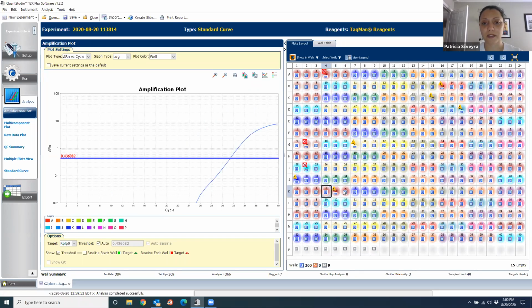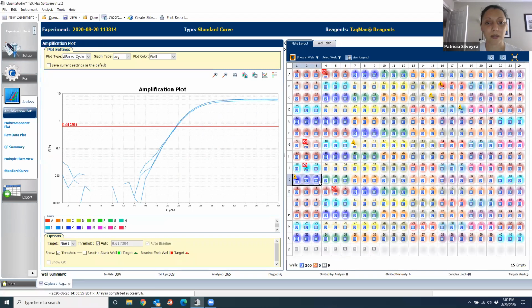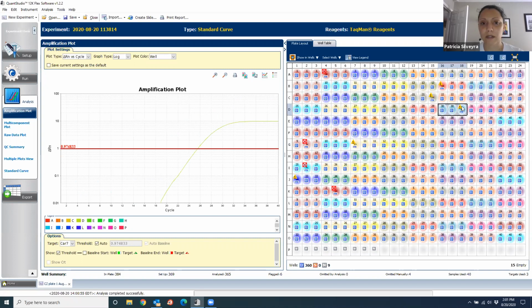See, the first well is okay, second well, the last well is okay, middle well, here you forgot to pipette it. So perfectly fine. So if we omit it, now we got rid of the problem. And now we have this one that, again, it shows like an error, but I think it's because of all of this that's happening here. So we don't care about that because it doesn't affect the result. All right, so I feel like I already looked at all of them and I cannot see anything problematic at a first glance.